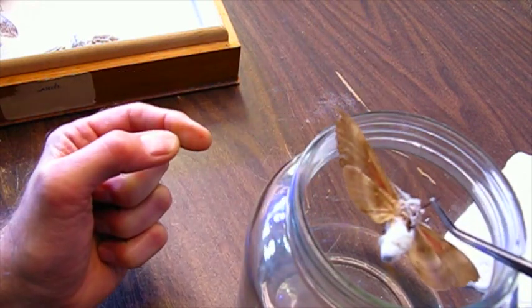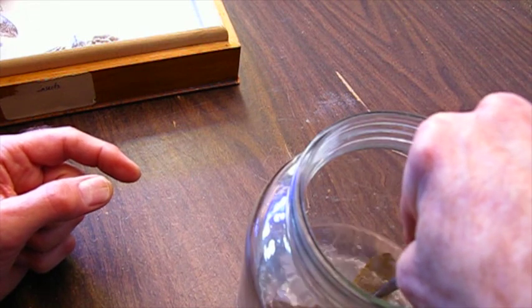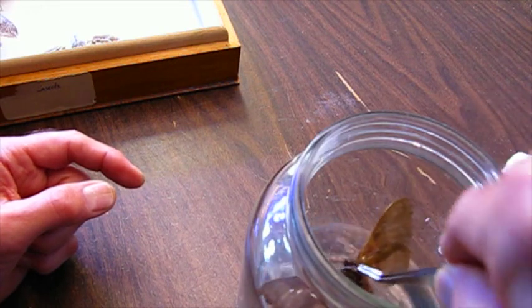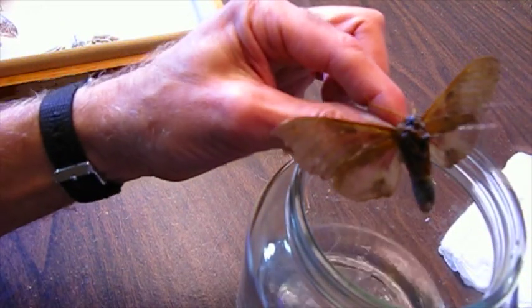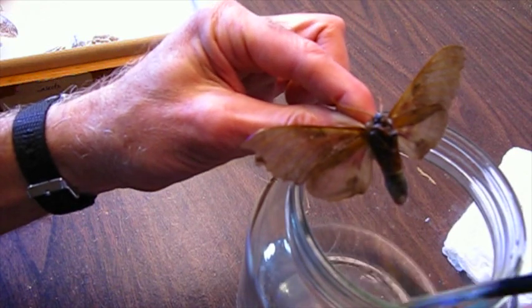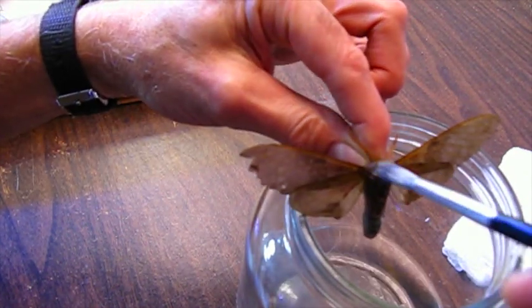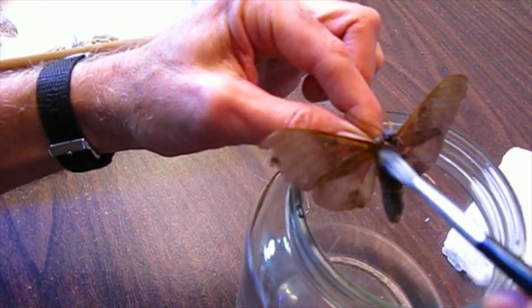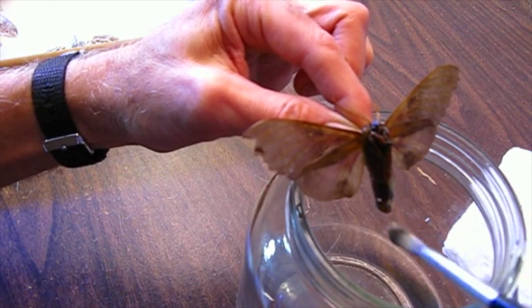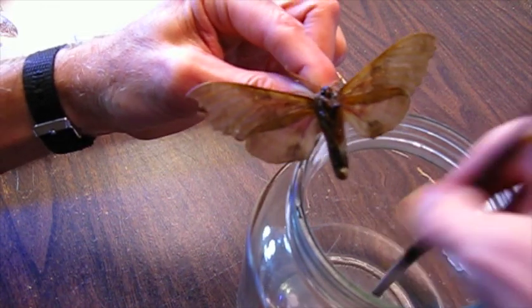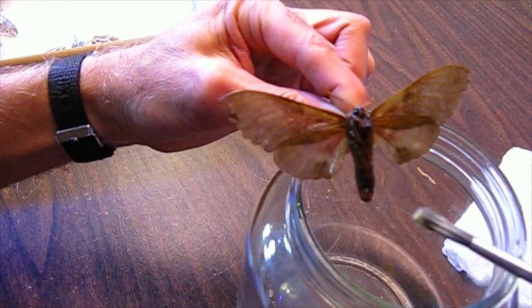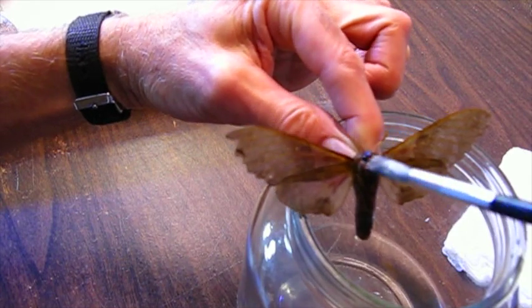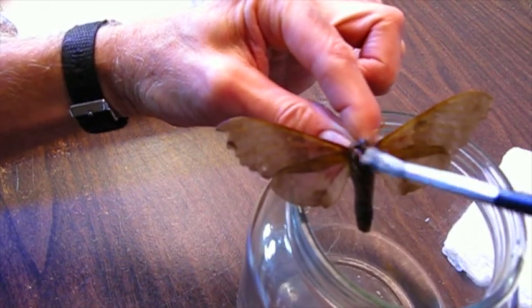I'm going to plunk this in, swish it around. Gently with the brush, start on the head and I'm going to work my way down. Wow, that's a lot.